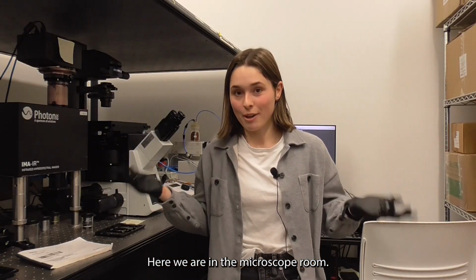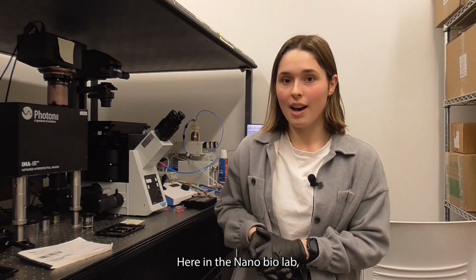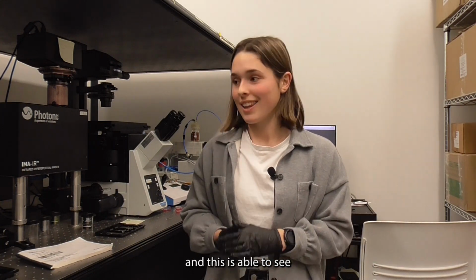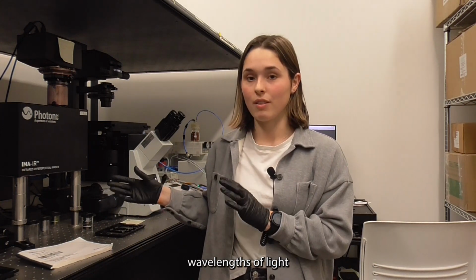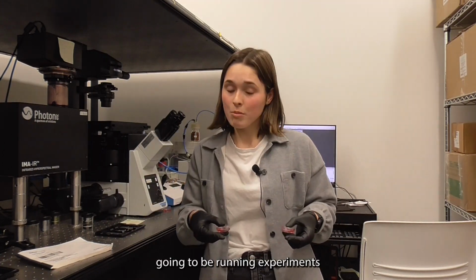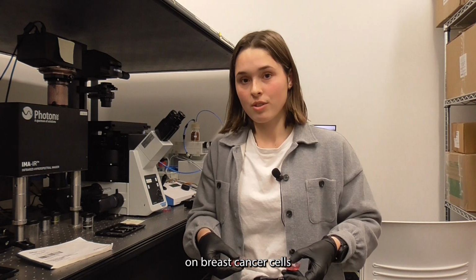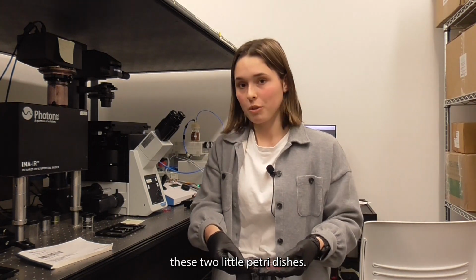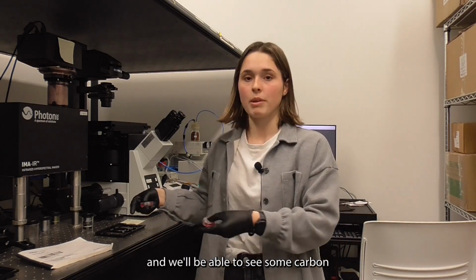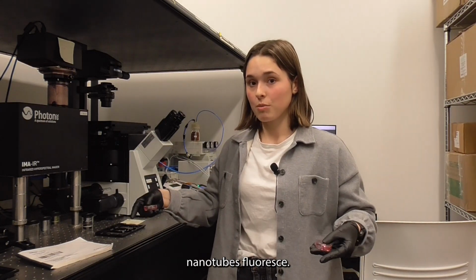Here we are in the microscope room. Here in the NanoBio lab, we have a specialized near-infrared microscope, and this is able to see wavelengths of light just outside of what our human eyes can see. Today, I'm going to be running experiments on breast cancer cells that I have growing in these two little petri dishes. I'm going to image them using this microscope, and we'll be able to see some carbon nanotubes fluoresce.